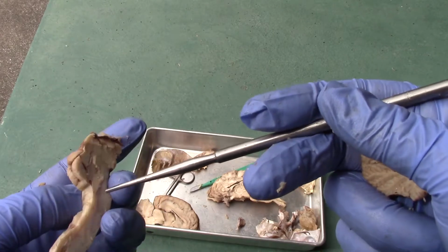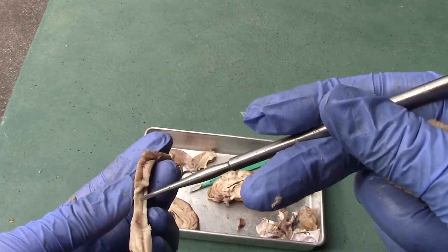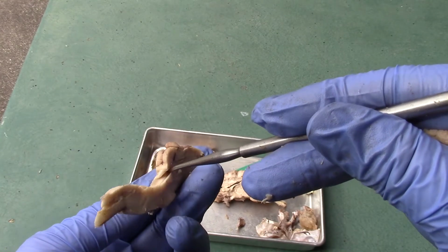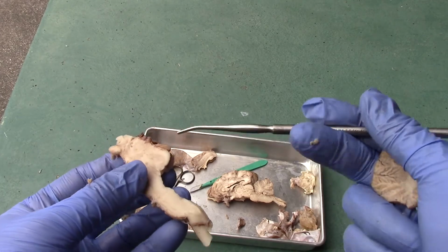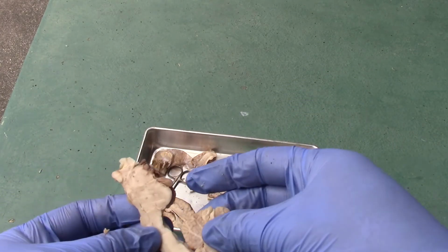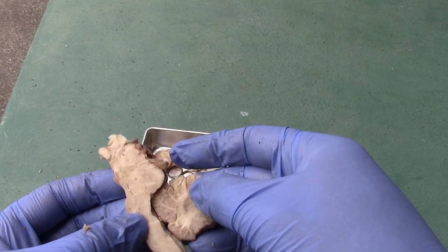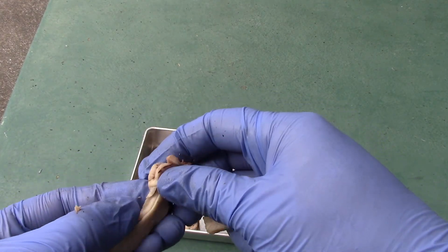And if you take off this little membrane over here, notice there's a little groove over here, and this groove is part of that cerebral aqueduct coming from the third ventricle, and then eventually going to the fourth ventricle. If I were to put the cerebellum back with it, okay, the fourth ventricle, once again, is that space there. So that's the cerebral aqueduct over here.